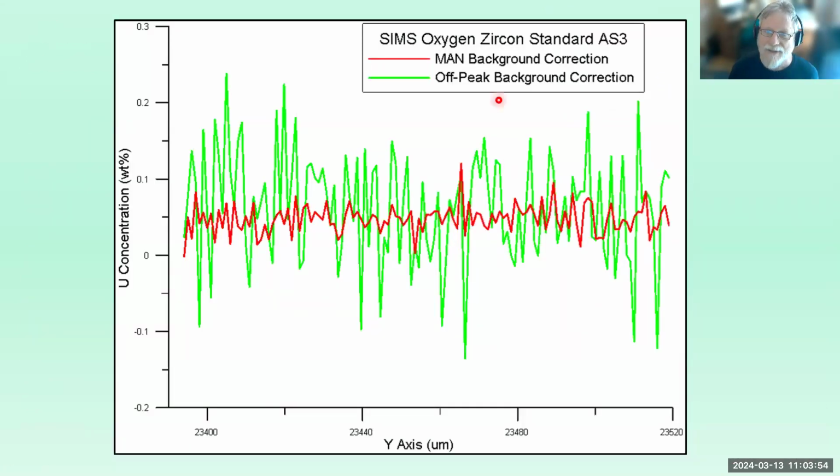And in fact, here's a comparison looking at uranium concentration as a trace element in a material. We measured the material with off-peak backgrounds. And then we threw away the off-peak background measurements and just used the MAN background correction. And you can see we get much better statistics. And that's just the beauty of the MAN correction. You don't need to acquire anything on the unknown, and you get better statistics.